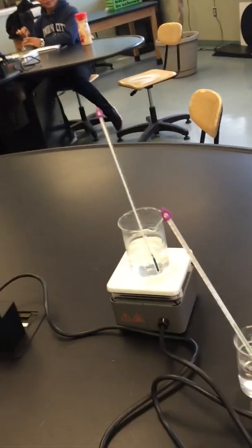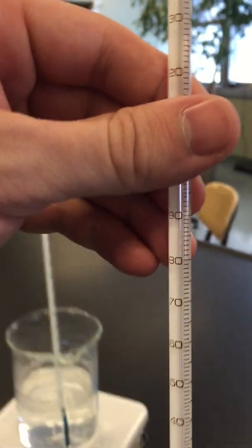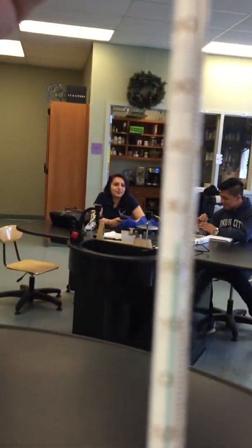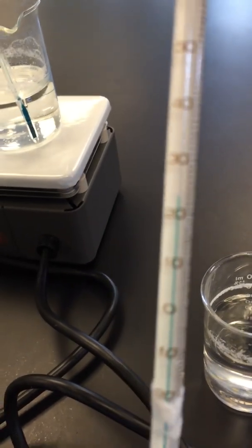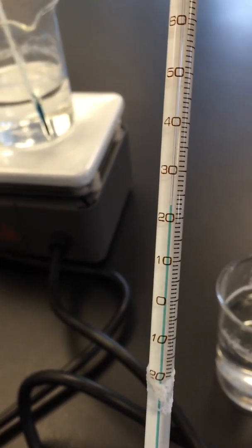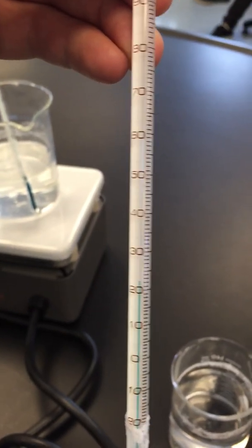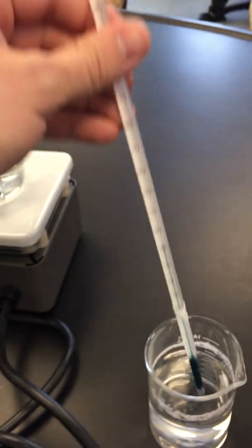So over here I have one beaker and the water temperature is... All right, so we think 23. Everyone record this number, put 23 into your notebook. Okay, so 23 degrees Celsius.